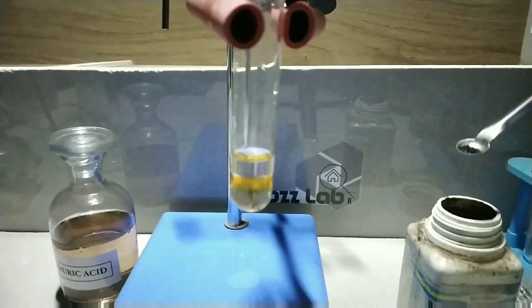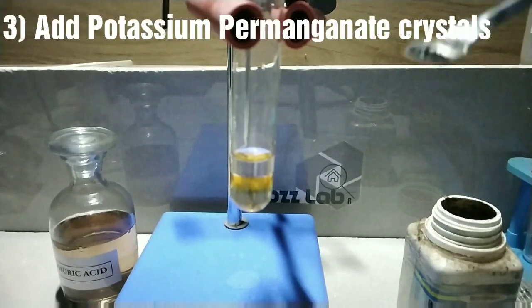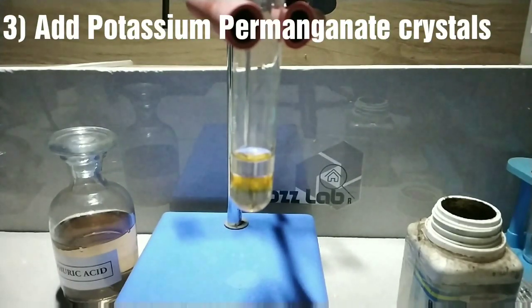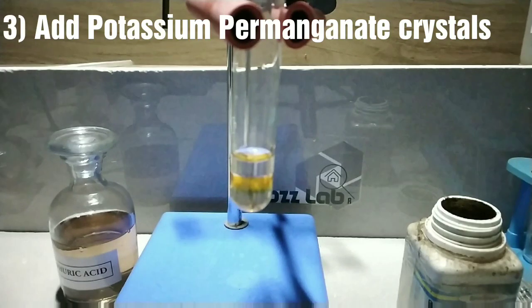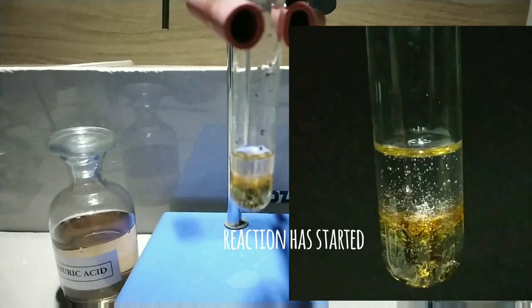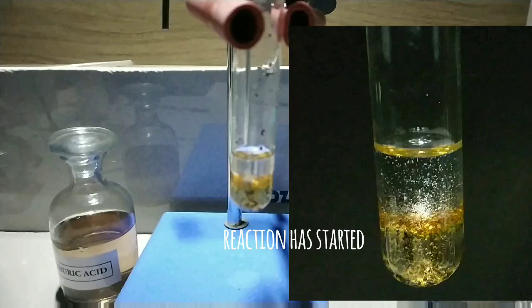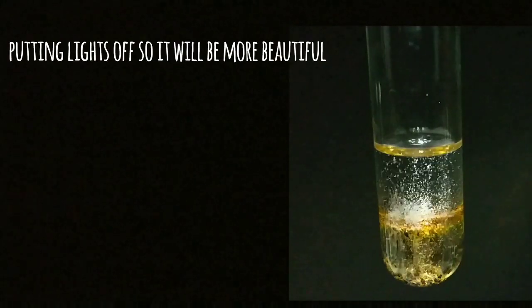The third step is to add the crystalline potassium permanganate into the test tube. You can see the potassium permanganate has passed down through the alcohol and started to react with the acid.